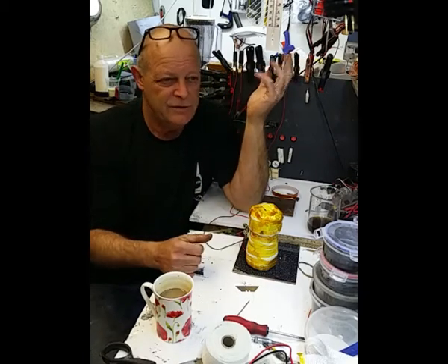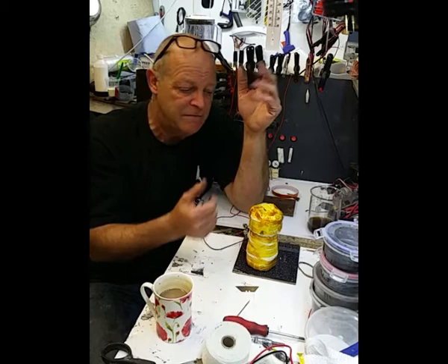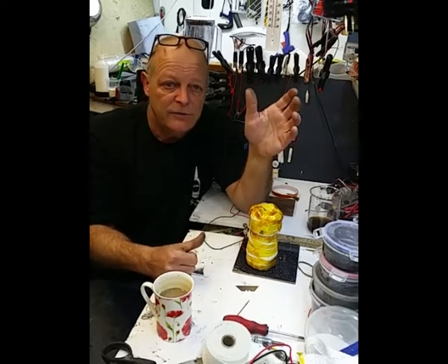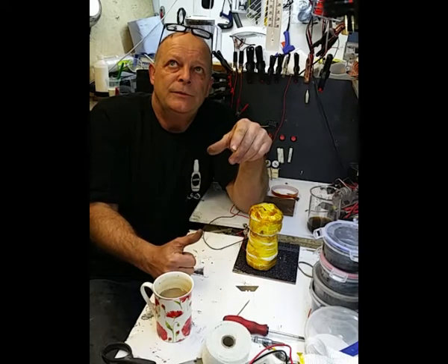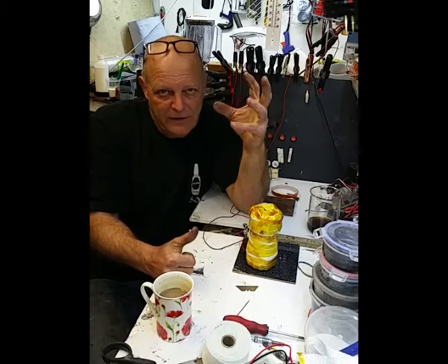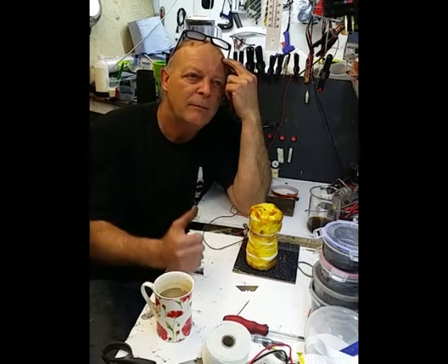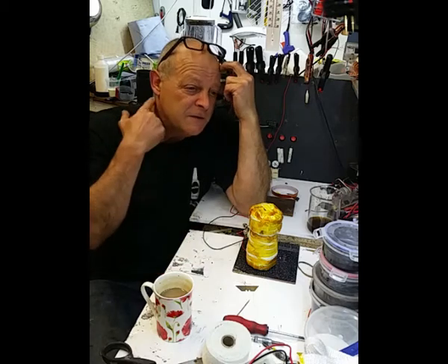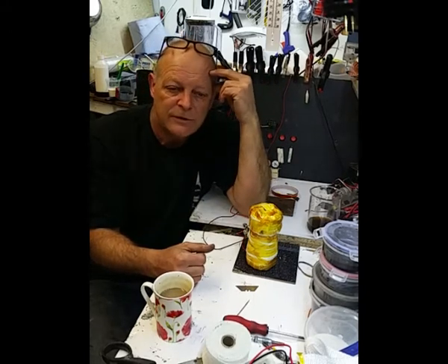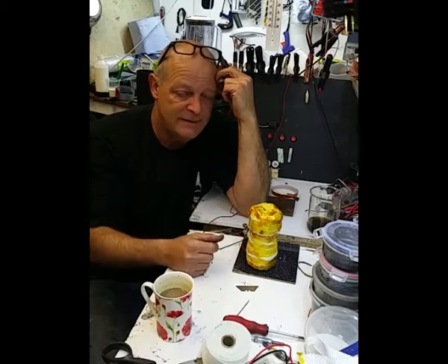Obviously I've got a power supply there, a switch mode power supply. It goes up to 10 amps, 30 volts, 10 amps maximum. If I'm going to need, let's say 20 amps, I've got another power supply which is somewhere, not in here because I don't use it, and it will do 20 amps comfortably at 30 volts, which I don't need. So yeah, not thinking it through, most people won't have access to a big power supply, but they're quite cheap now. That big one, I think I paid about £84 on eBay. It is a piece of lab equipment, you need a decent benchtop power supply. So what I'm going to do is shut up now and get on with this and heat it back up.